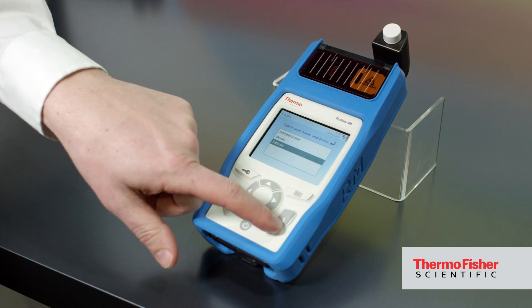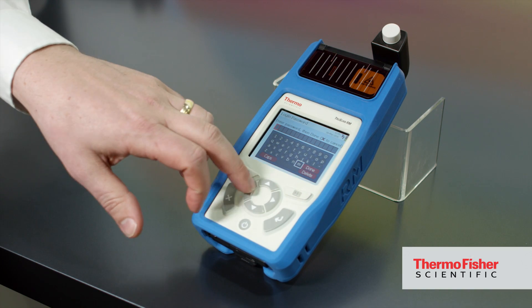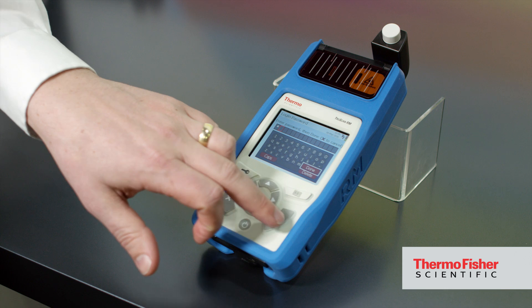Before, we really just had a purpose-built solution for raw material identification or identification of an unknown material. But what we have today is the capability for users to design their own decision engine — their own algorithm — to look at the samples of their interest.